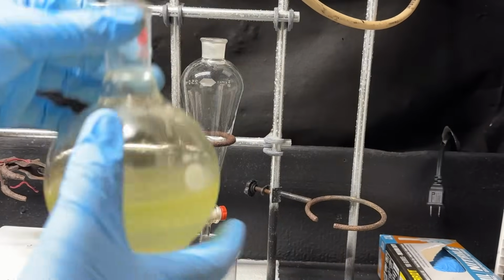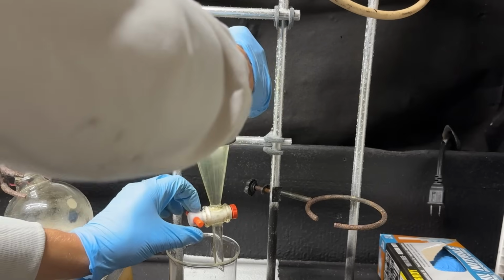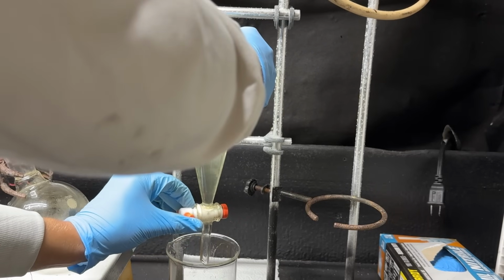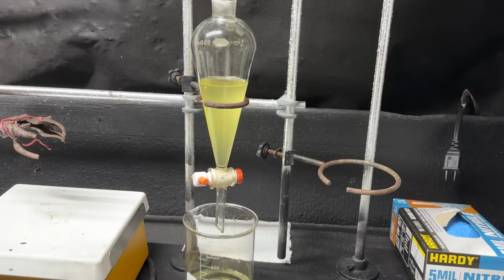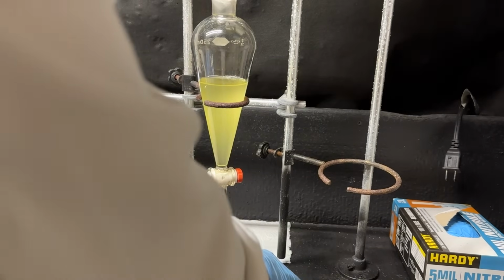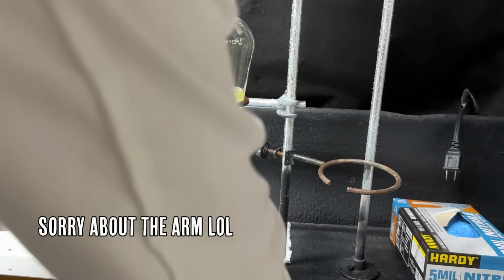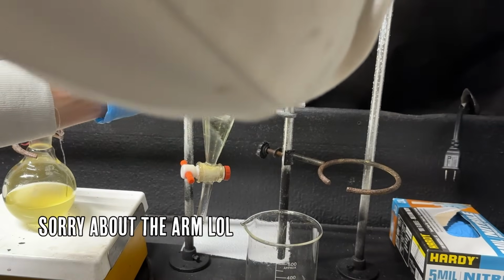Okay, now we're going to go ahead and dump this all into a sep funnel. Now we're going to go ahead and discard our aqueous layer. Okay, now for all of our toluene layers, I'm going to use a 250 milliliter round bottom flask. And now I'm going to wash with another 50 milliliters of toluene. And now we'll just give that a good shake.